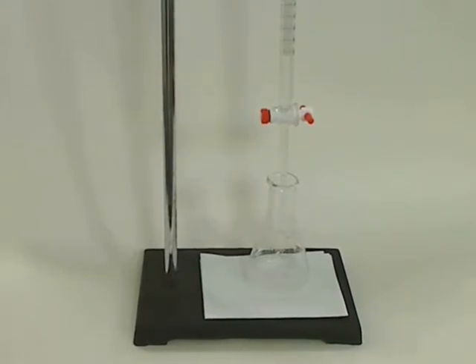I want to go over some of the basics of using a burette and the proper procedure for doing an acid-base titration.